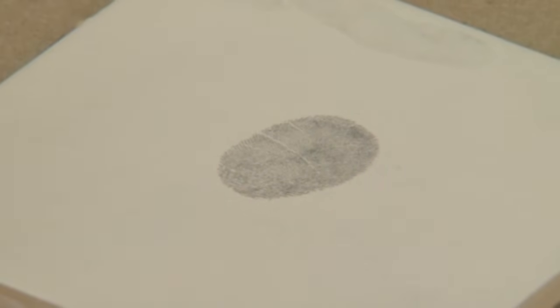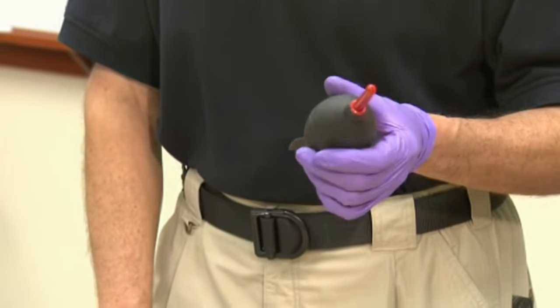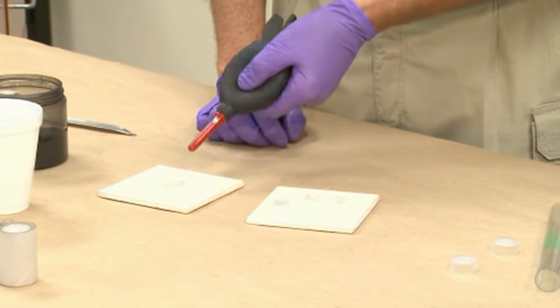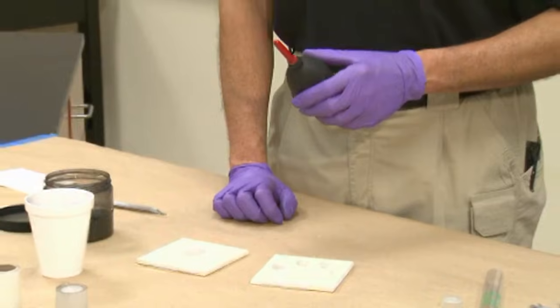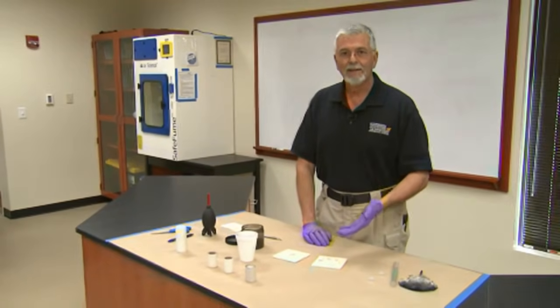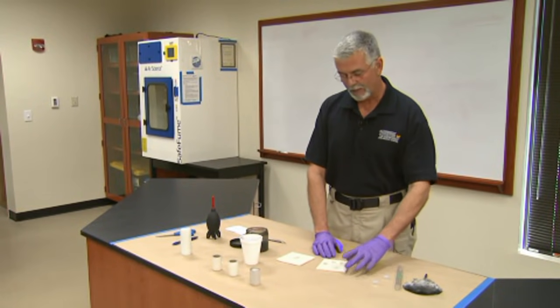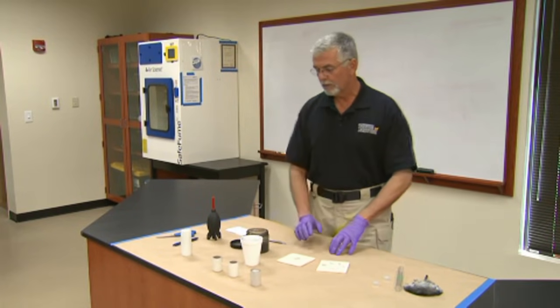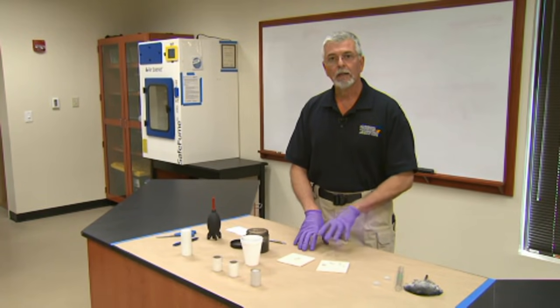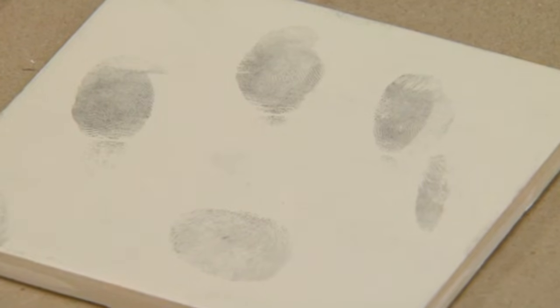Another piece of equipment is a squeeze bulb, normally used for lightly putting air pressure on electronic equipment. We also use this to blow any excess powder off — it's used a bit more with magnetic powders. We wouldn't dare blow on this with our mouths because then we're imparting our DNA on it if that became an issue. That's why we use the squeeze bulb. That's how we process using a non-magnetic powder — it's good on very smooth surfaces, and the result is a black print on a white background, which is ideal for comparison purposes.